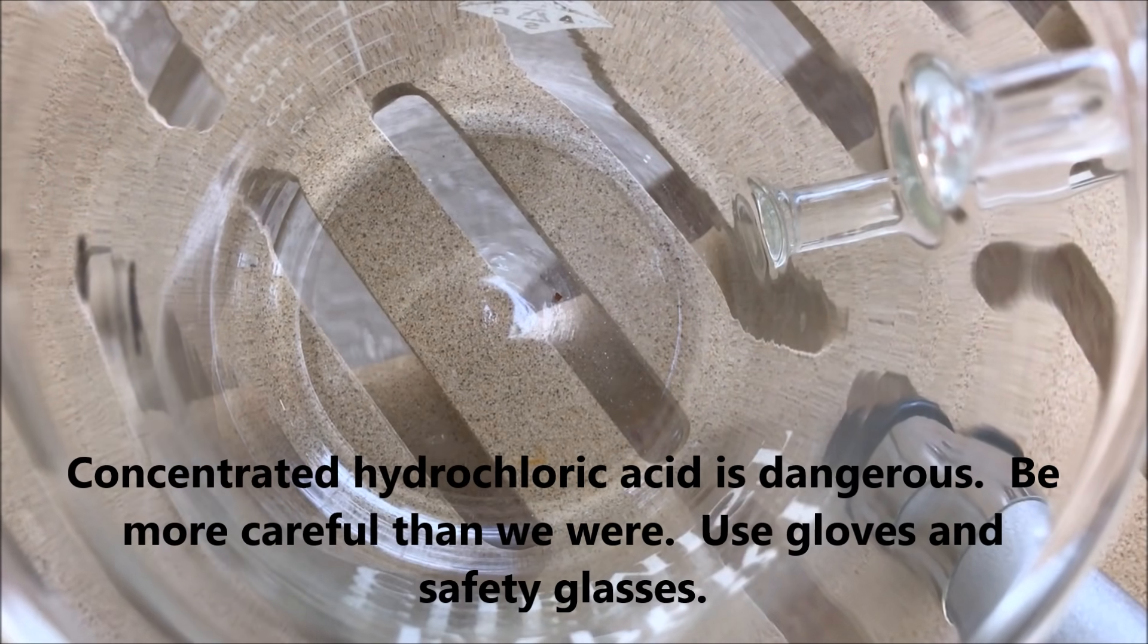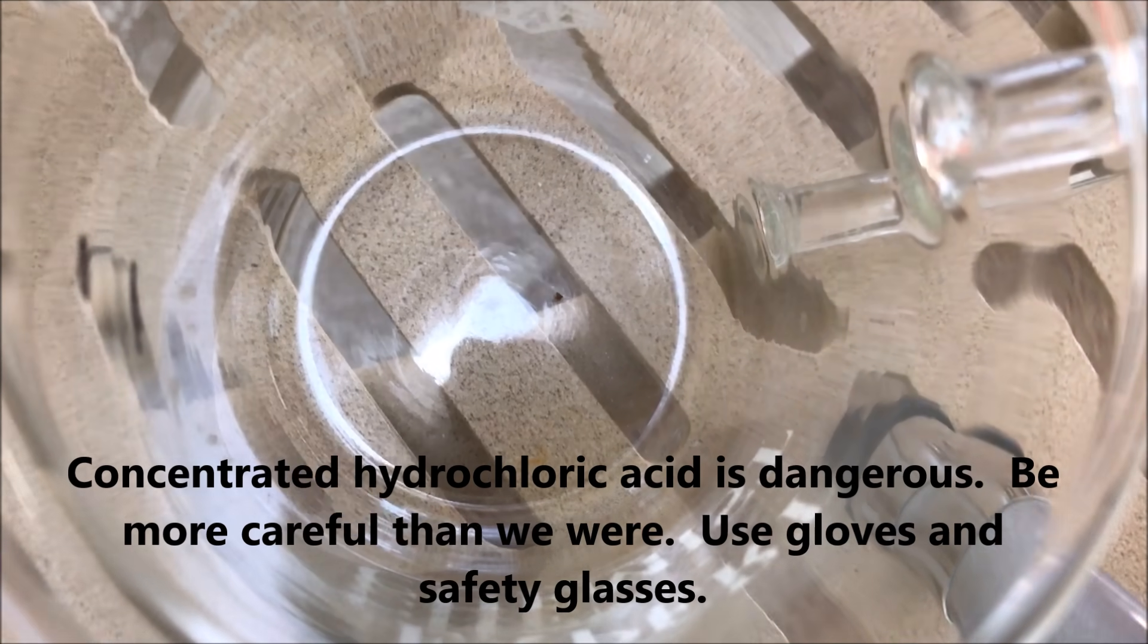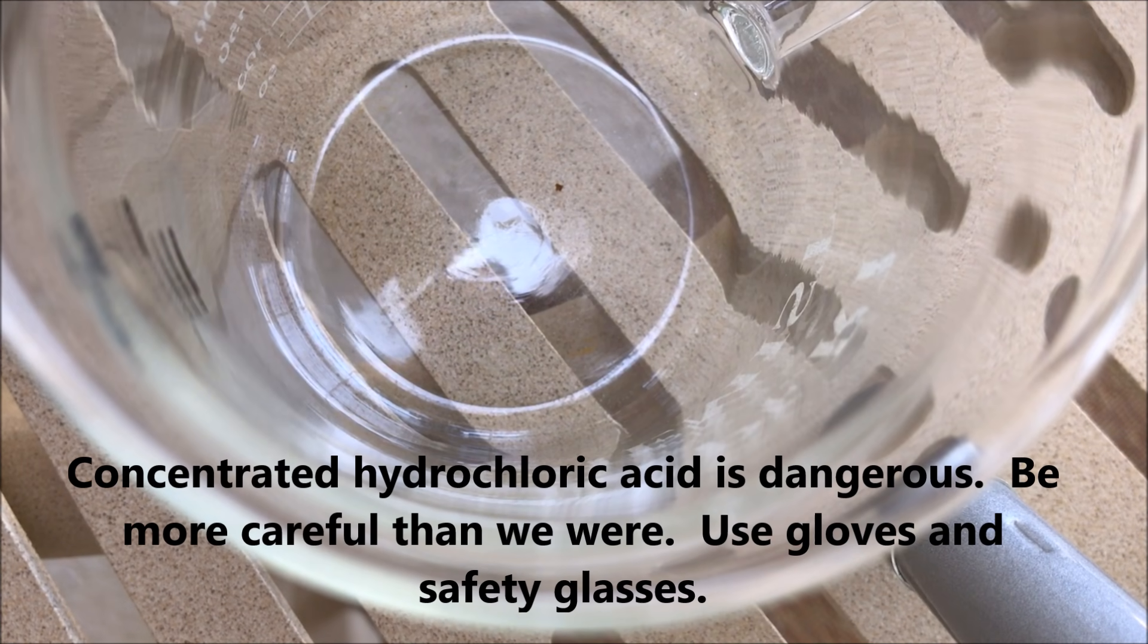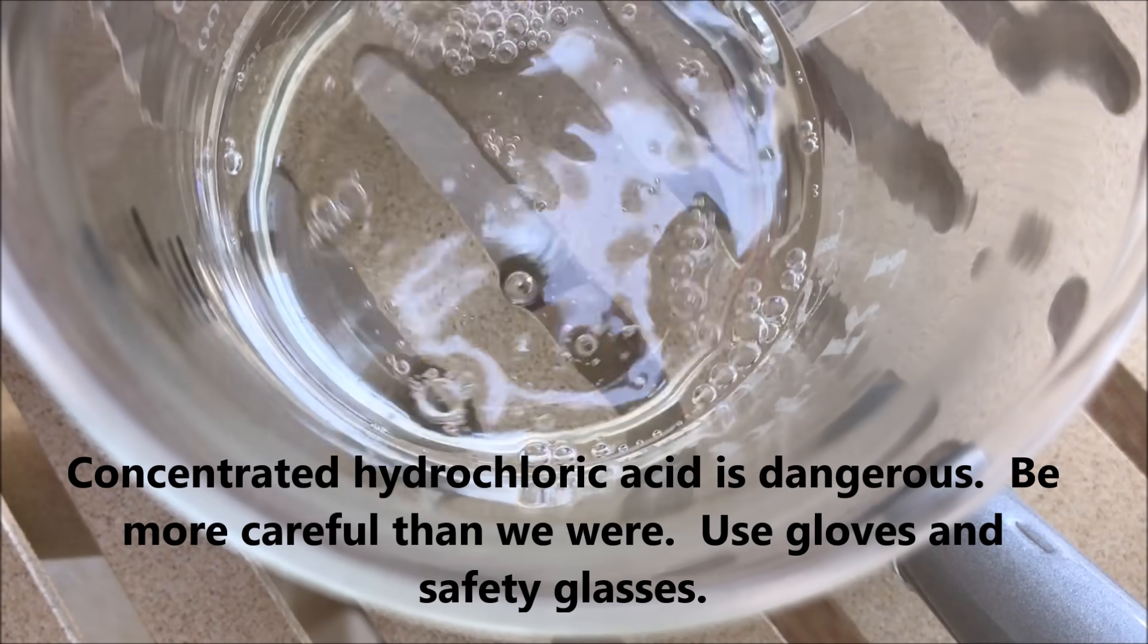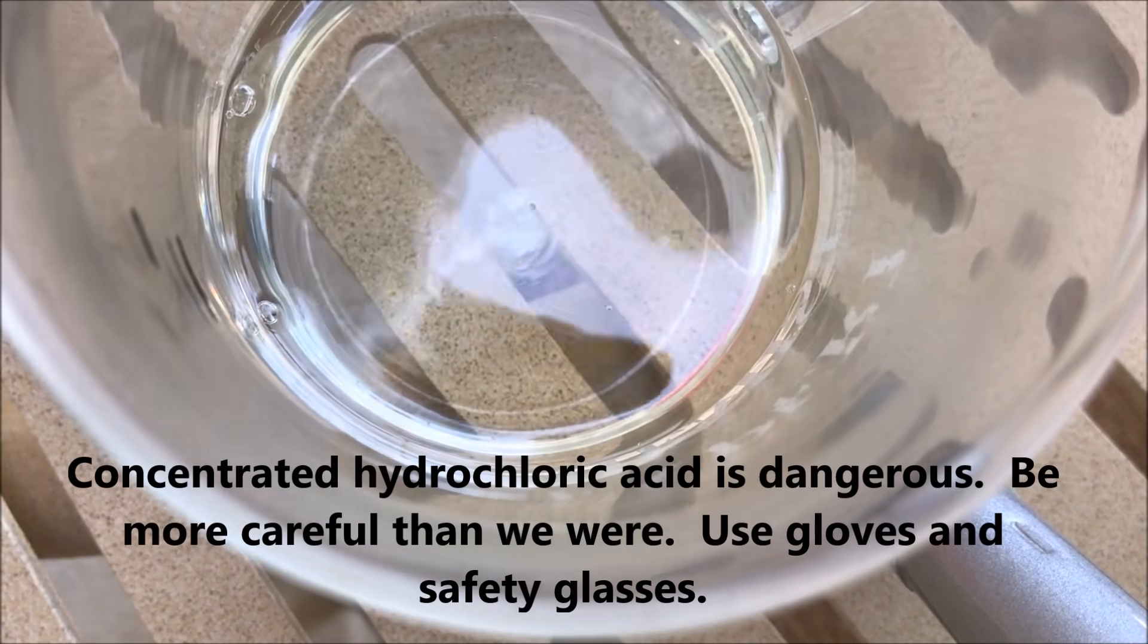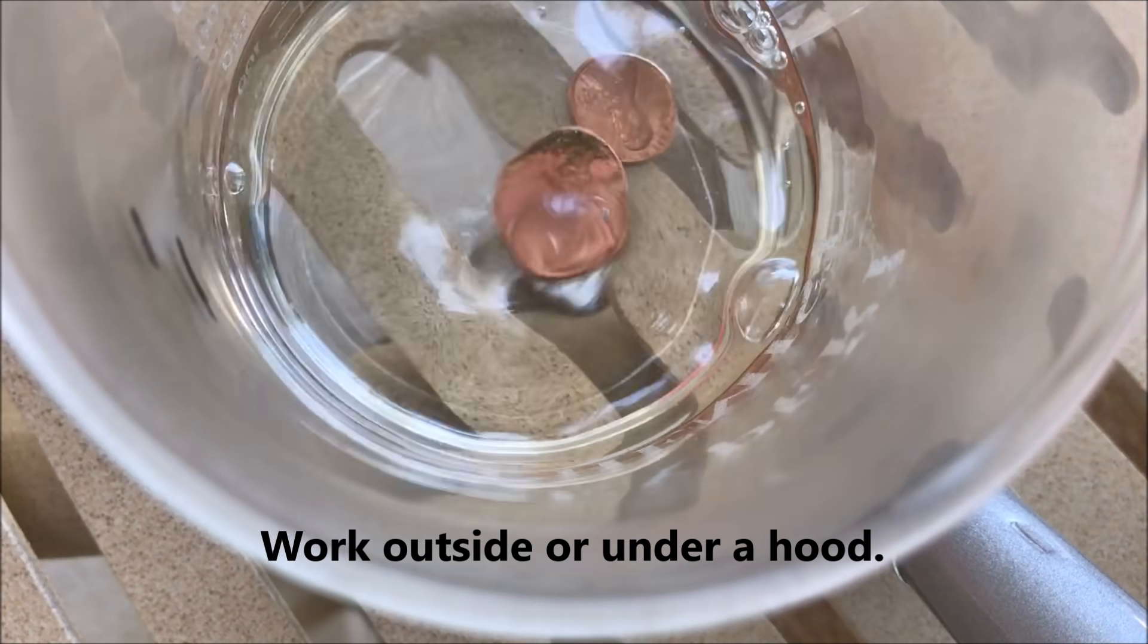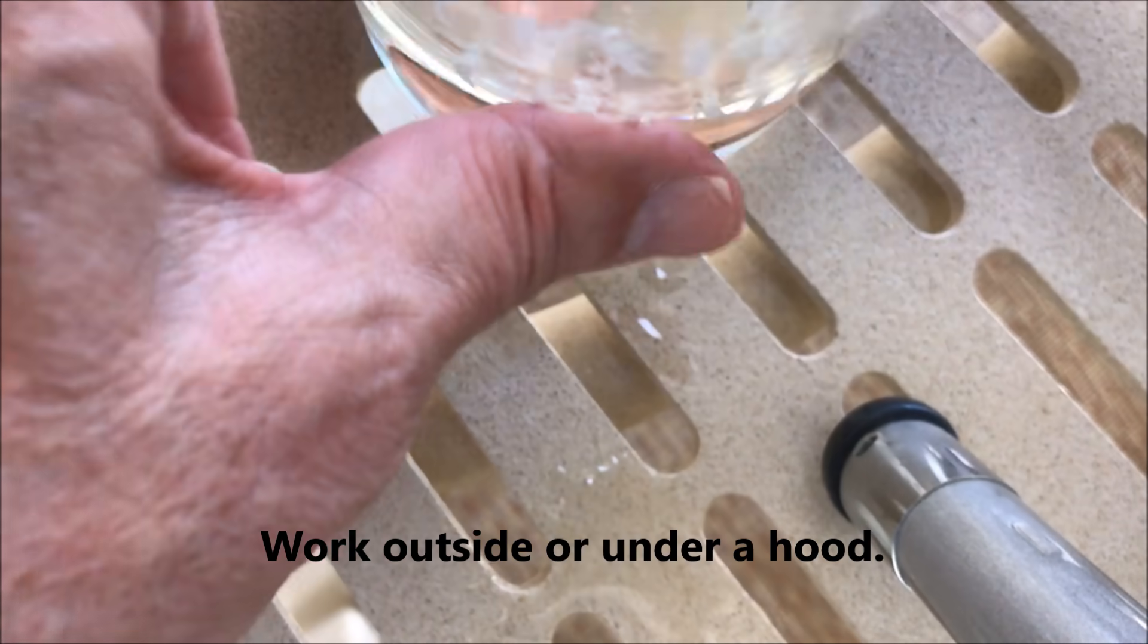I've got some hydrochloric acid and it's 31.5 percent. So I'm going to pour some into this beaker. And now we're going to drop the two pennies in.